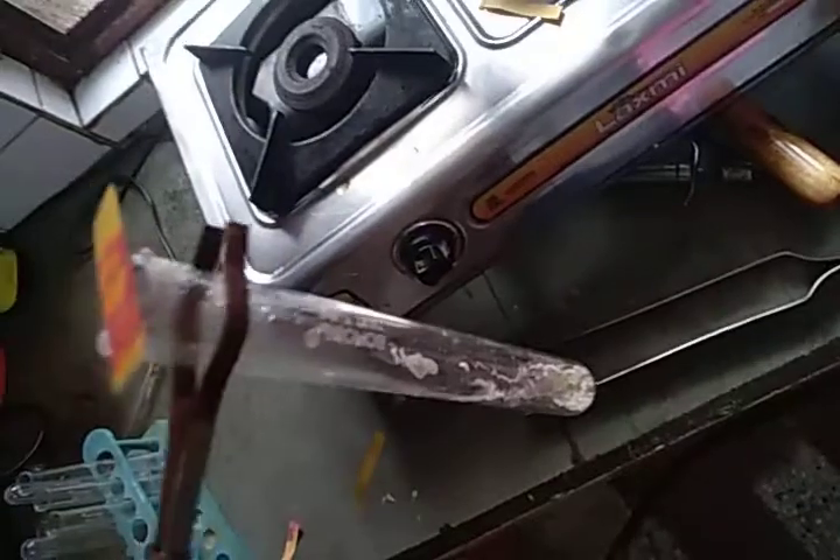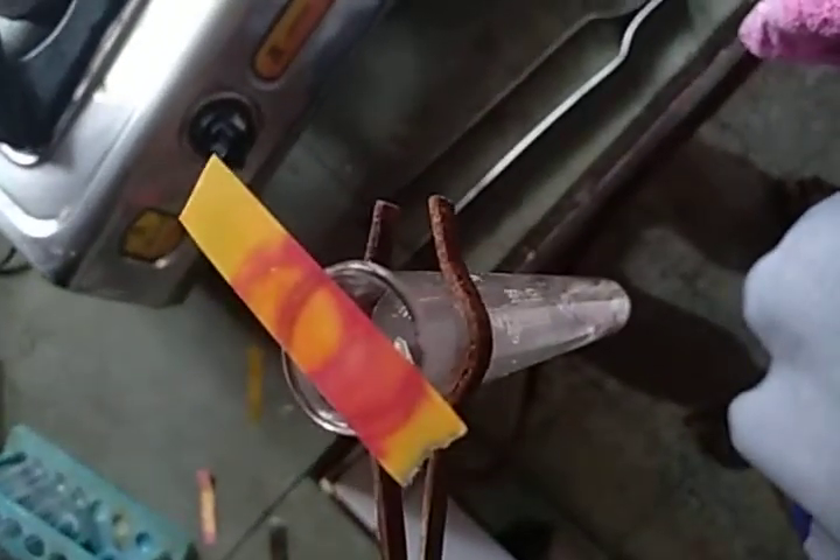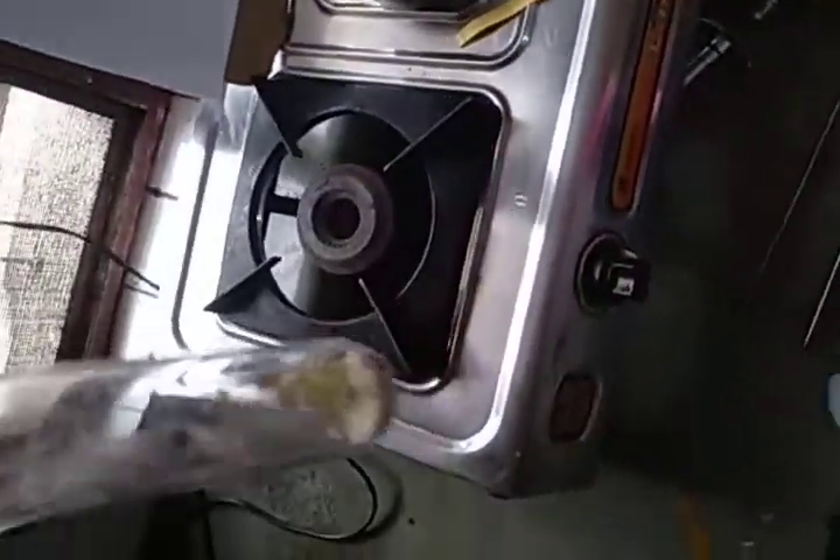The gas is still coming out and this gas makes the paper turn red. This is how we can understand that the gases coming out from the test tube are sulfur dioxide gas and sulfur trioxide gas, which are acid gases that turn the wet litmus paper red. Here we have the crystals of Fe₂O₃, which are the crystals of iron(III) oxide.